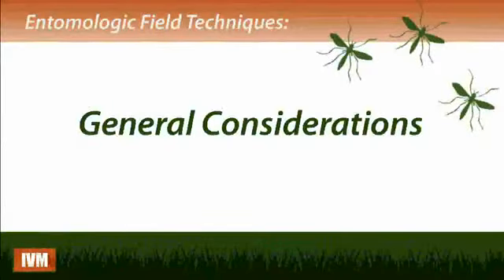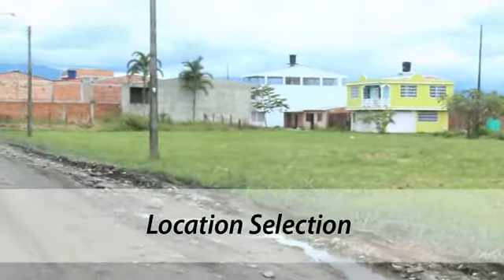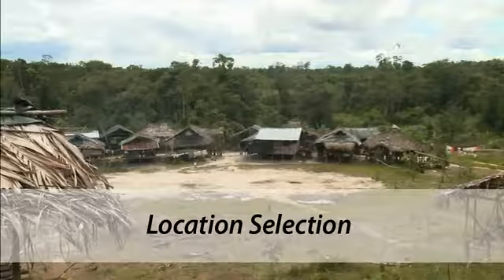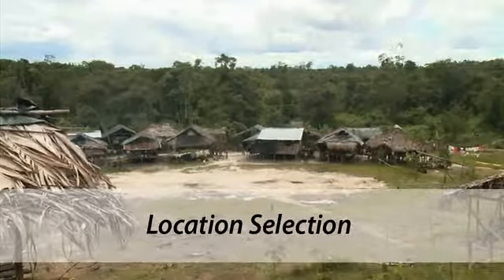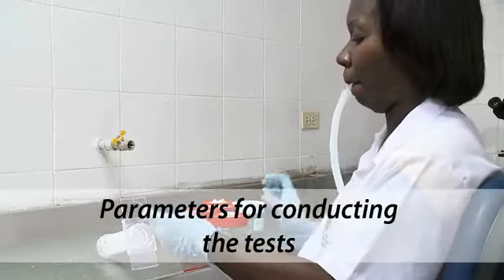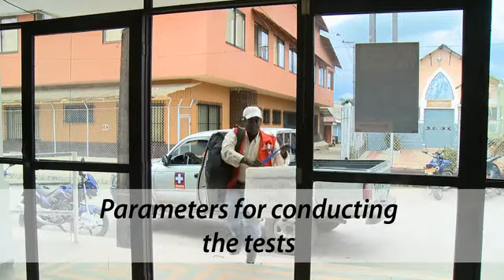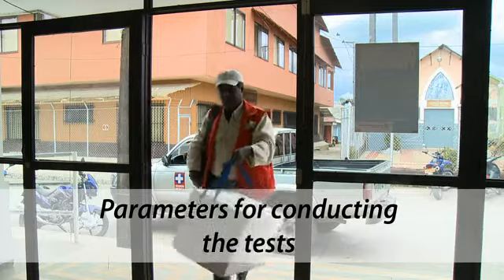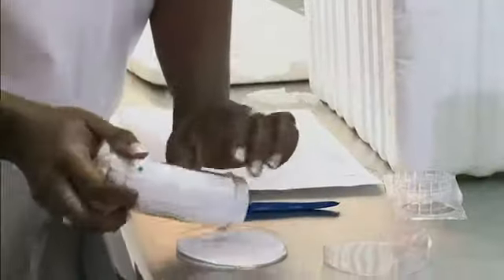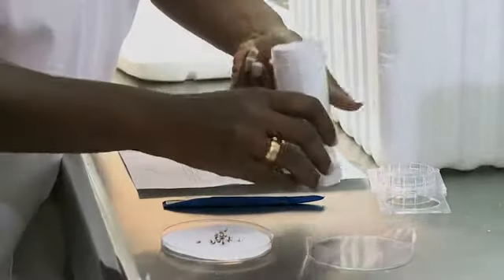There are some general considerations to be aware of before starting the tests. These include: the places or sites of entomological surveillance priority should be established by the country programs, taking into account previous use of vector control interventions and available resources. WHO tests should be done at least every year in entomological surveillance priority sites in disease vector species for different groups of insecticides and those that are in use, including those incorporated into the fiber of the long-lasting insecticidal nets.